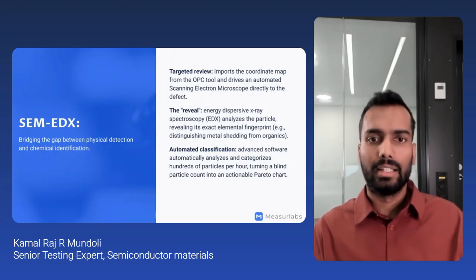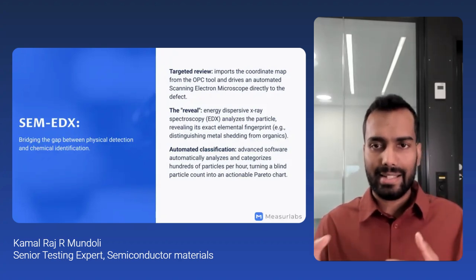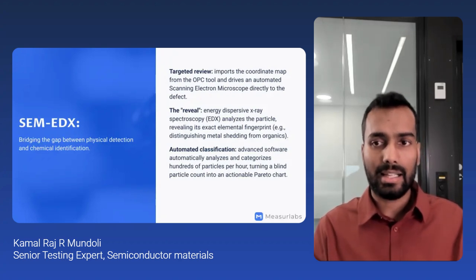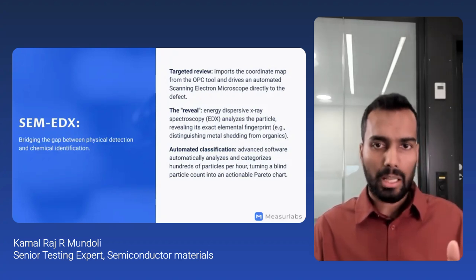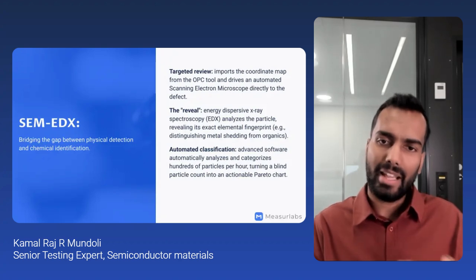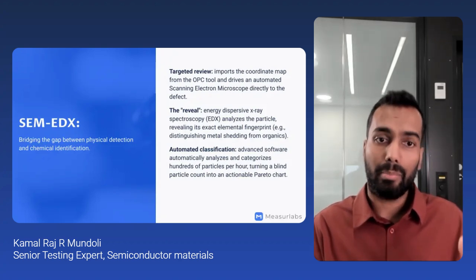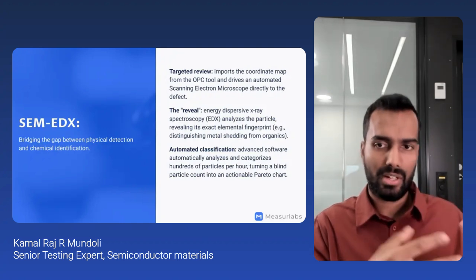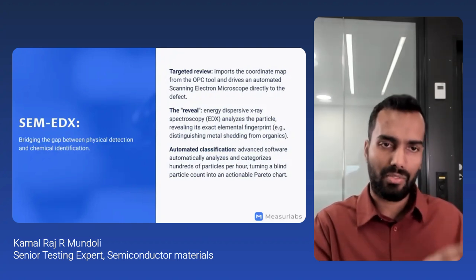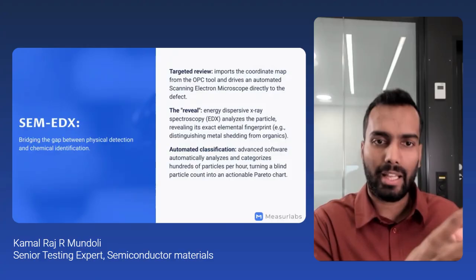And finally, the software handles the automated classification by instantly analyzing and categorizing hundreds of particles per hour. This completely transforms a blind particle count into an actionable Pareto chart, immediately showing your engineering team which tool components are failing and causing the most severe contamination, and what percentage of contamination is arising from that particular source.